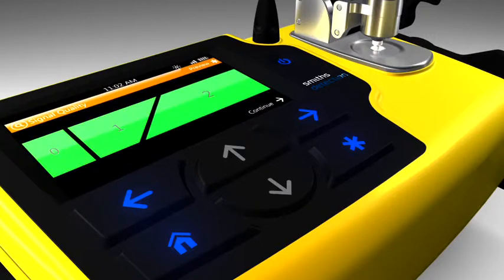The same red and green indications are provided when the system is switched into touch-to-sample mode with the second Diamond interface. From this screen, the user also has the option to select the star key to preview the infrared spectrum in real time. Finally, the user selects the right arrow key to initiate the data collection process.